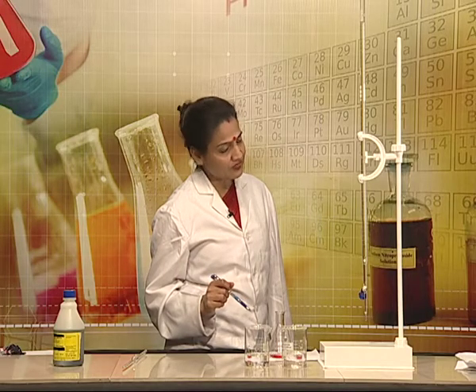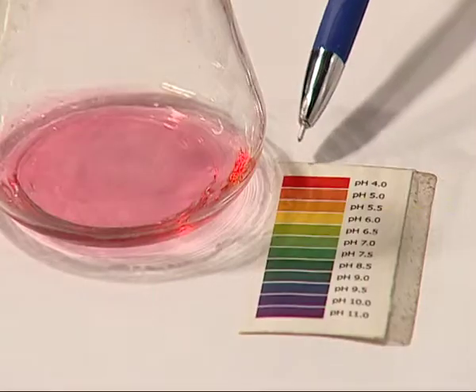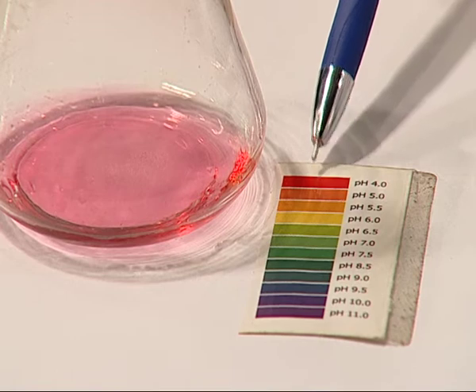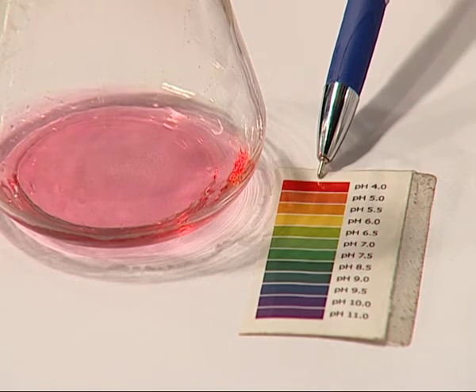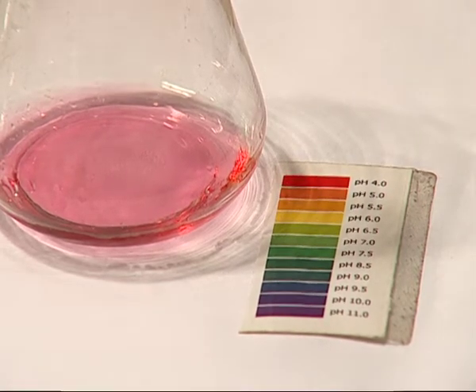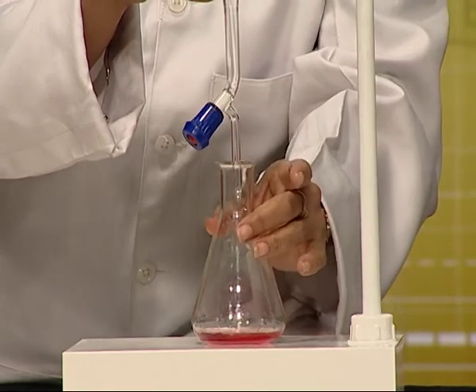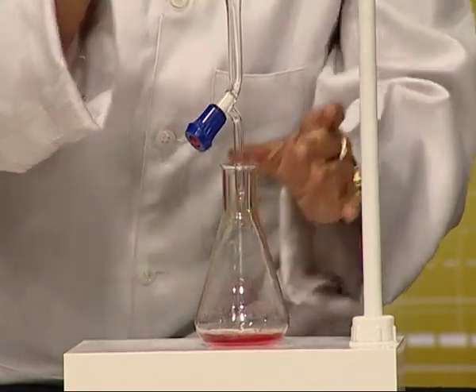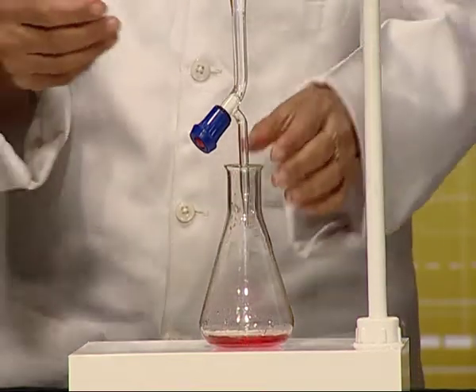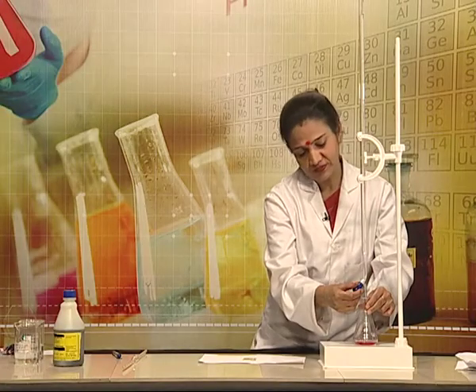Observe the colour of the solution, which matches with pH 4. Now we start titration — the colour of the solution you can see. Now I will add sodium hydroxide solution drop by drop into the conical flask.